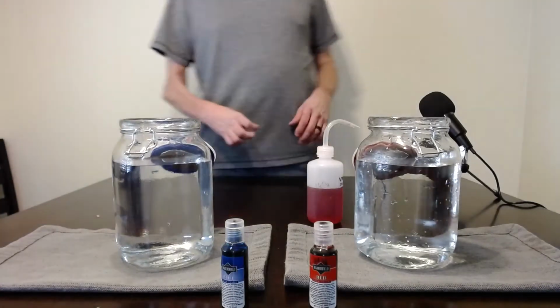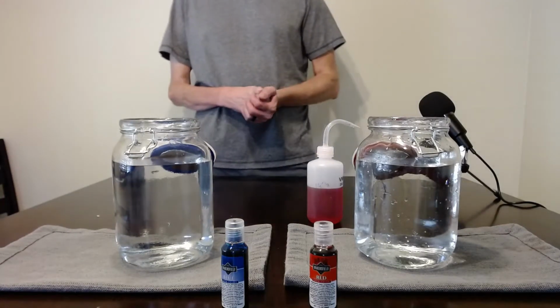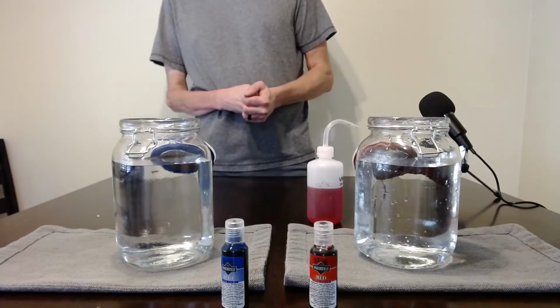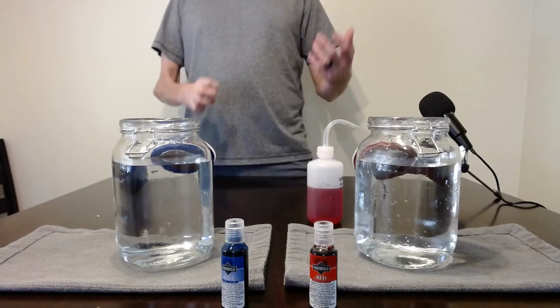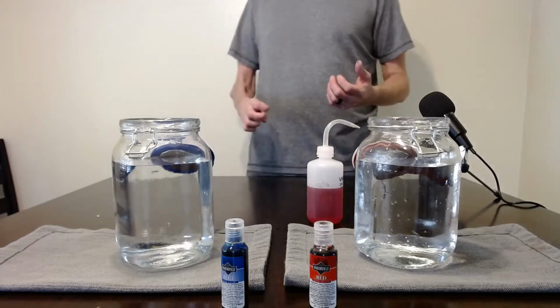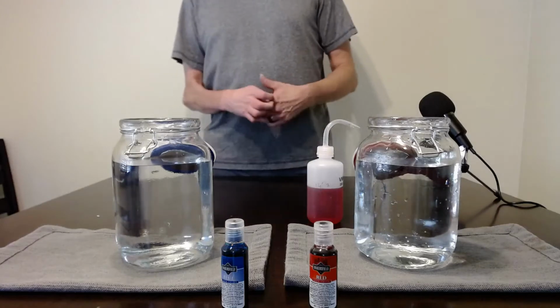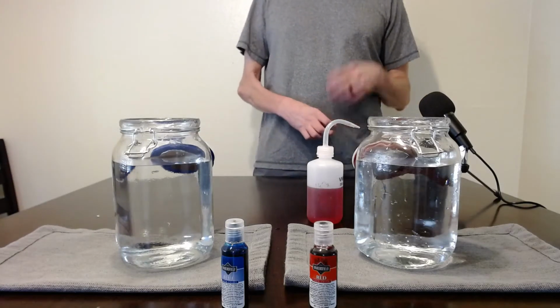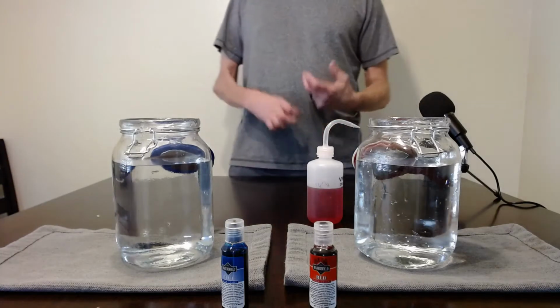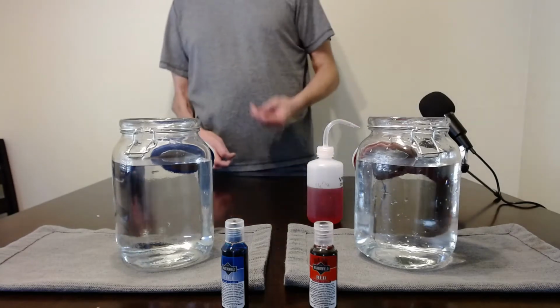Okay, so we're going to be doing experiment 1, starting off in your lab packet on lab number 5 today. And we're going to be trying to understand thermohaline circulation. First we're going to try to understand density differences. As you've seen in our lab, deep ocean circulation can be driven by differences in density, which is going to be affected by the salt content and the temperature.